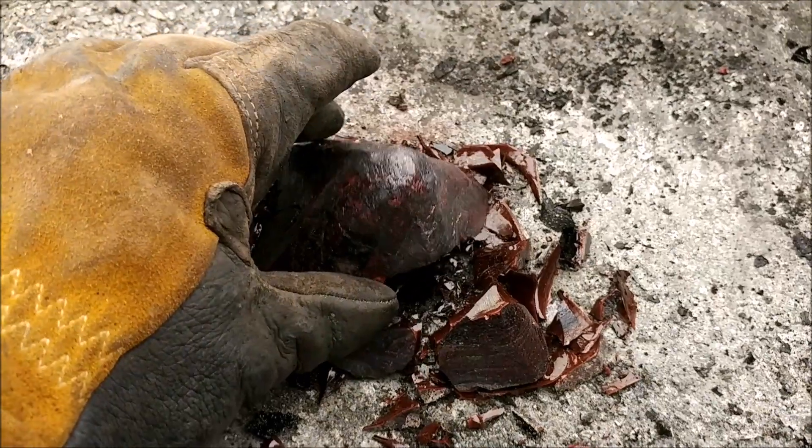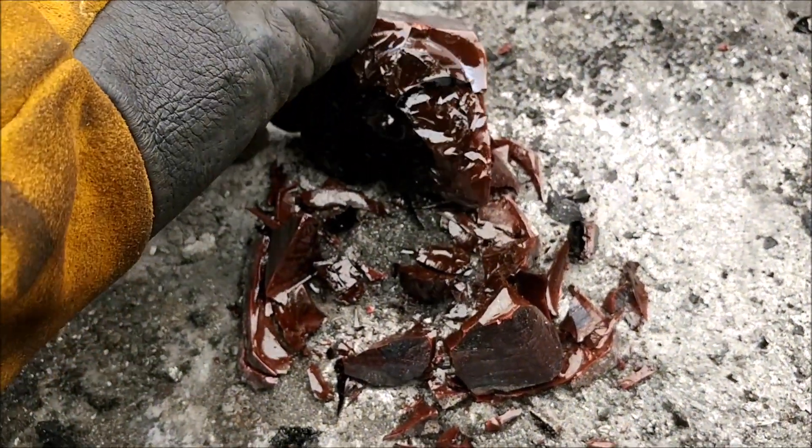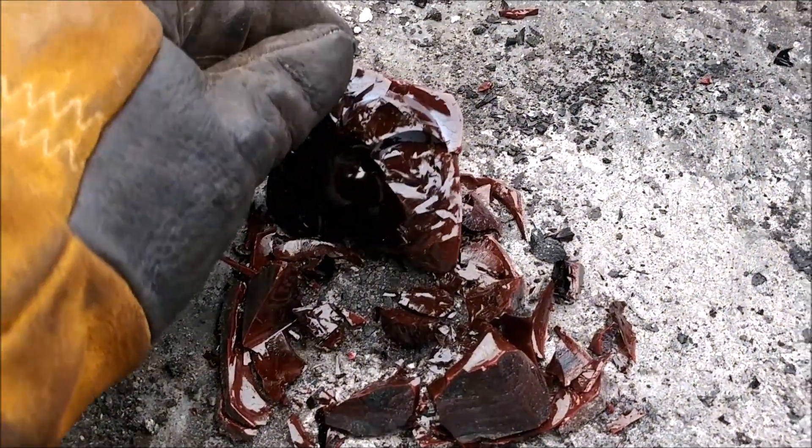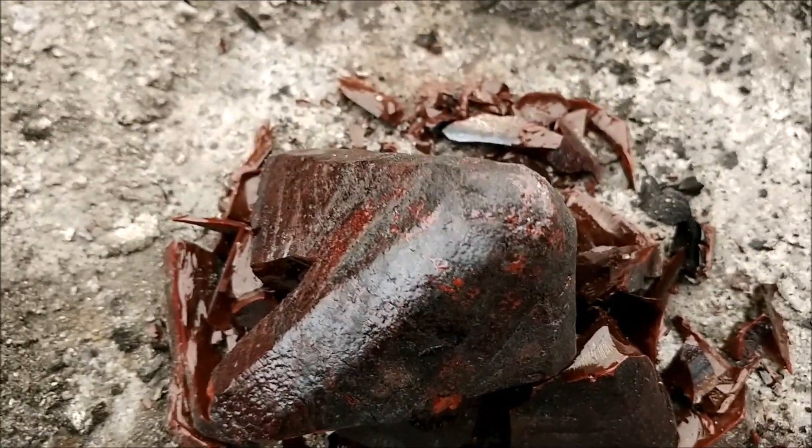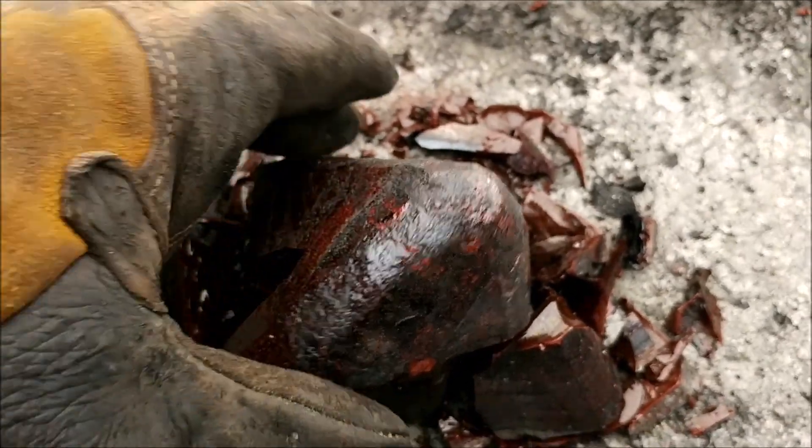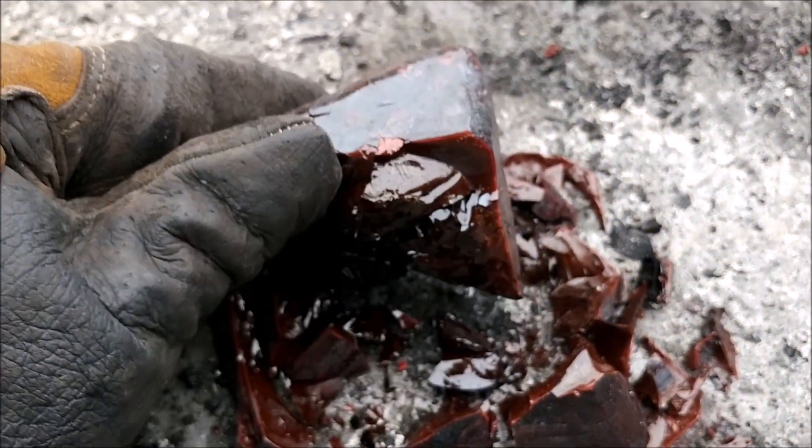Okay, here's the slag result from our Chapman Flux. It's really quite glassy. You can see there's no obvious metal at the tip of the cone, so I'll bust that open and see if we get a little tiny gold bead, which is what we hope for.